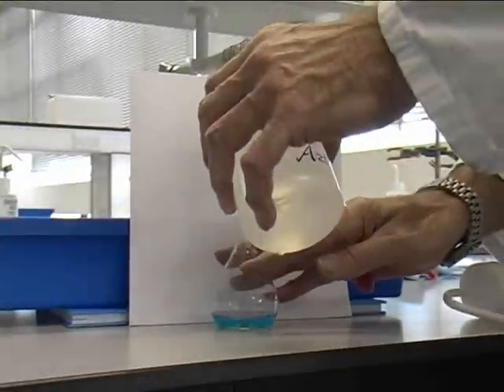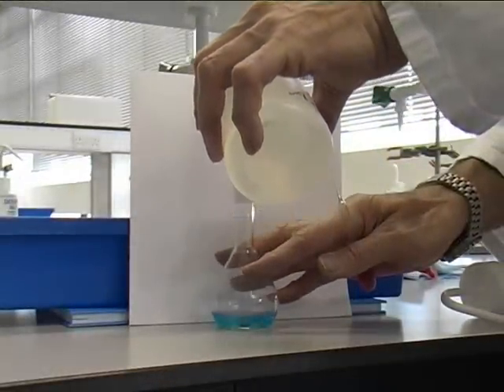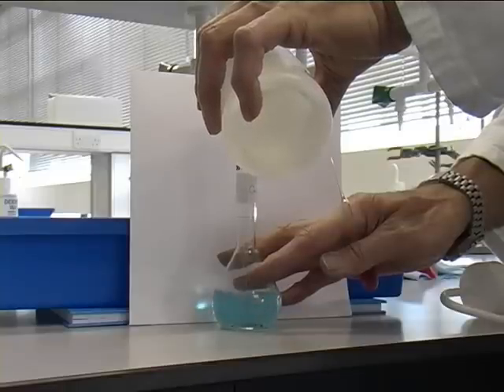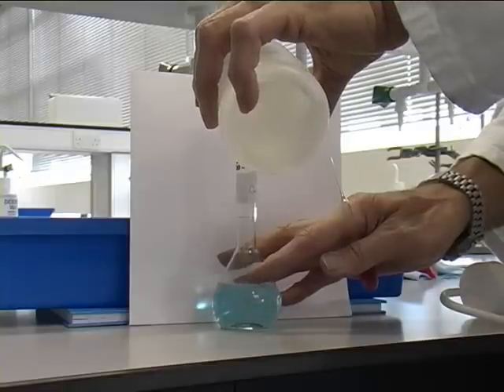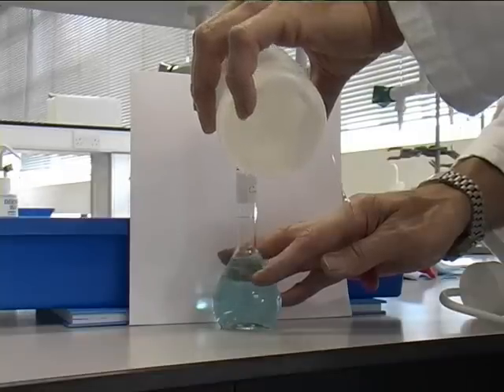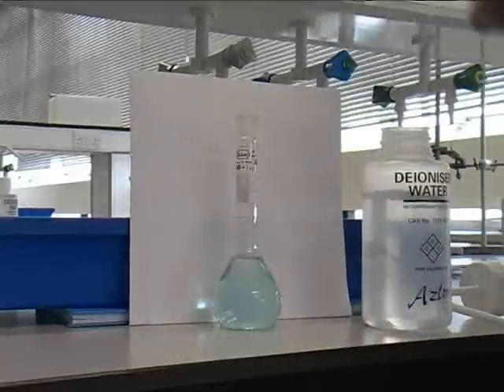Take the top of the water bottle and fill the flask to within 3 cm of the line. Now fill to the line using a clean Pasteur pipette.